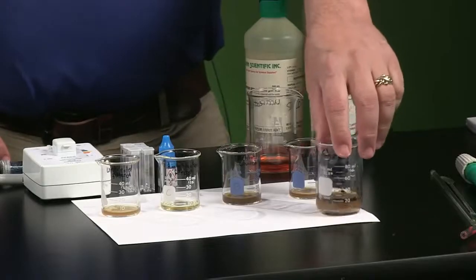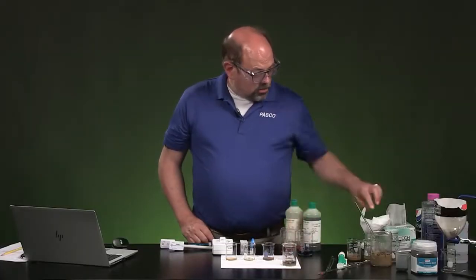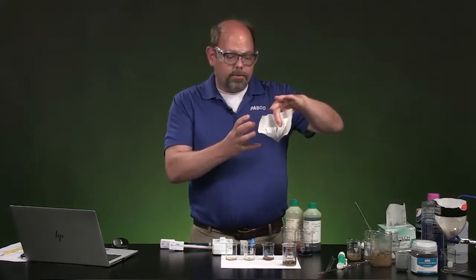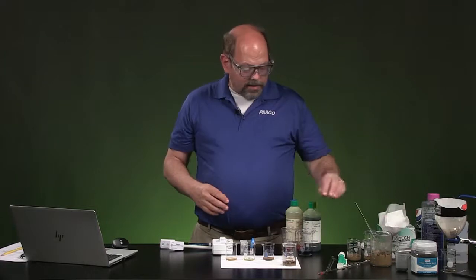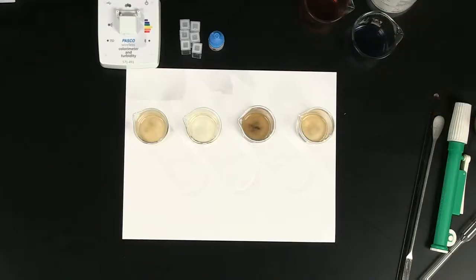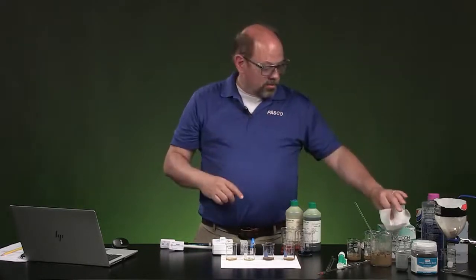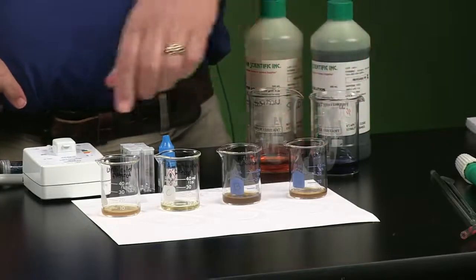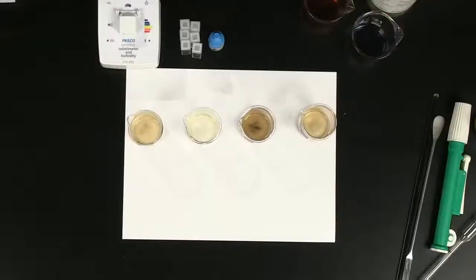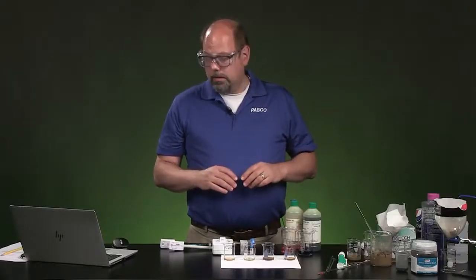Finally, we poured this into the filter that had the charcoal bits in it. Okay, so I impregnated the filter paper with activated charcoal. And when we filtered that out, we've got this look. Now, I also rinsed this a couple times to make sure it's not just the carbon from the activated carbon making it through. So it looks a little clearer probably than the one that was just raw, but they're very similar. Okay, so that was our starting process to get the data.